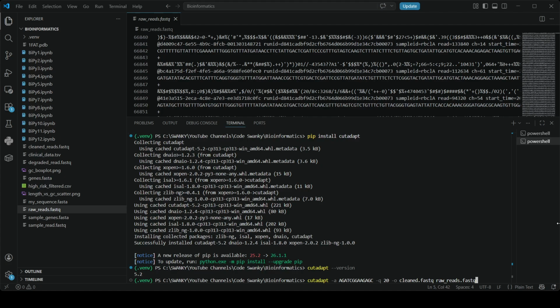Let us discuss this command. First, cutadapt is the command that will call the program. Then this portion, -a and this sequence: the a flag stands for adapter. We paste the standard Illumina adapter sequence here. Cutadapt will hunt for this exact sequence in every read and snip it off. Then the -q flag stands for quality. This tells Cutadapt to chop off the ends of the reads if the Phred quality scores dip below 20. The -o flag stands for output. This is the new clean file that we will be creating, and finally this is our raw input file. Okay, so let's hit enter and see what happens.